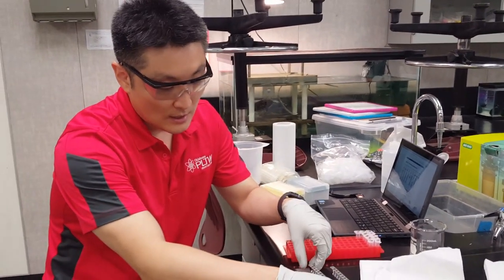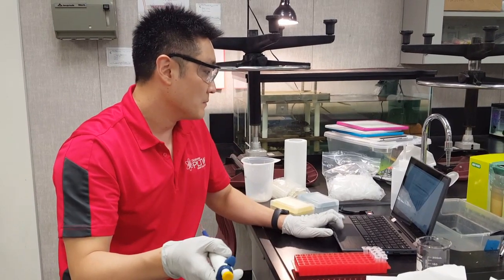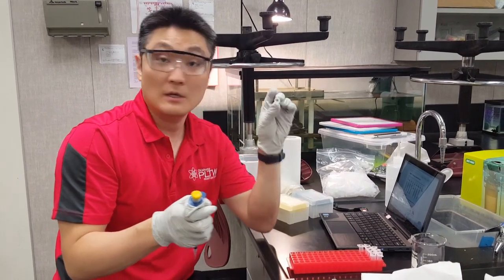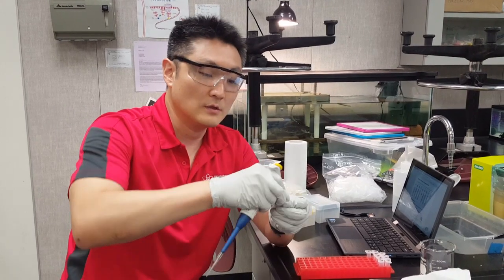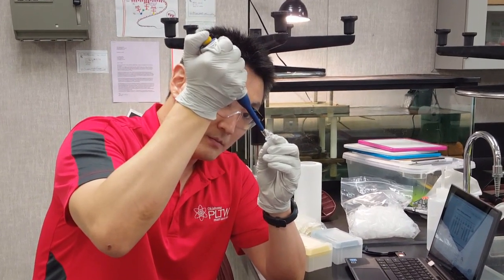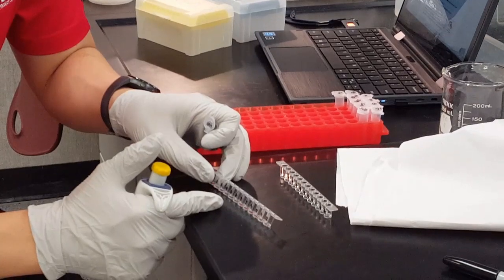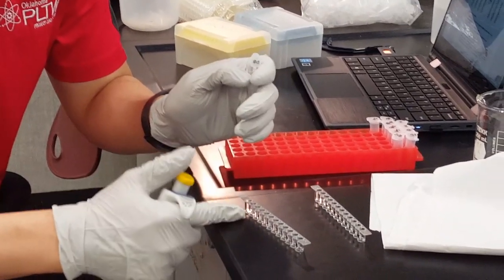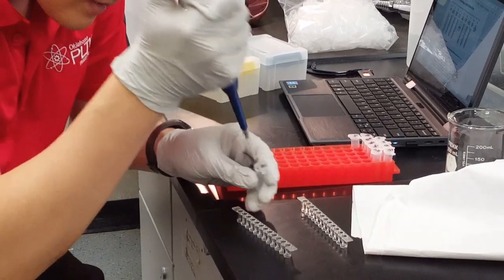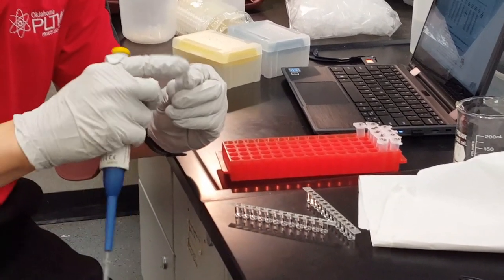First, after labeling your strips, you want to put in 50 microliters of the dilution buffer — labeled DB on your microtube rack. Set your micro pipette to 50 microliters and add 50 microliters to wells 2 through 12, skipping well 1. Continue adding 50 microliters to each well until wells 2 through 12 all have dilution buffer.